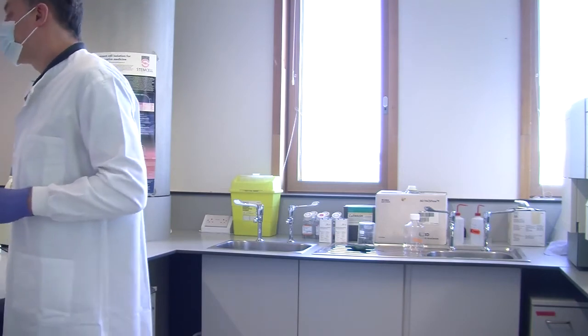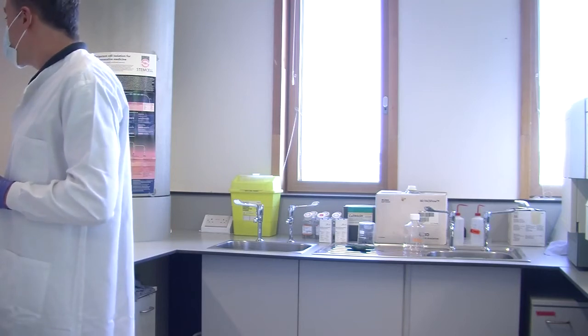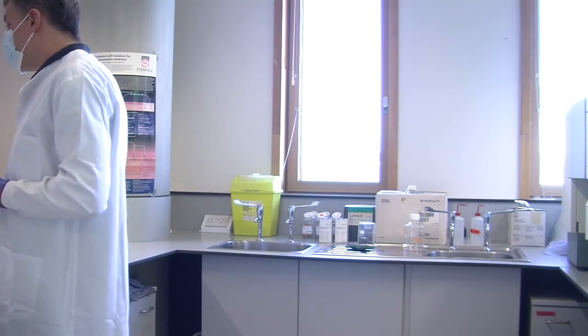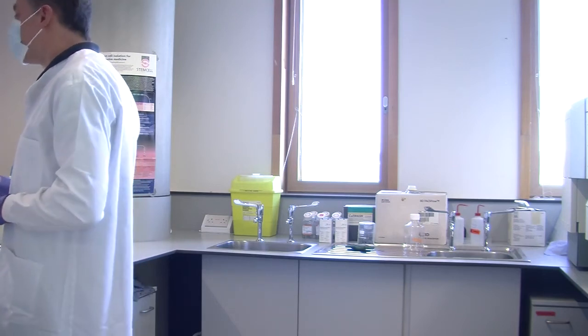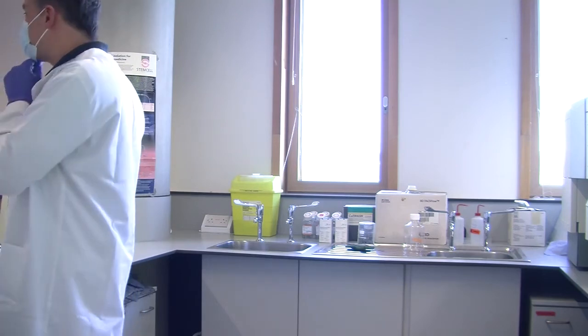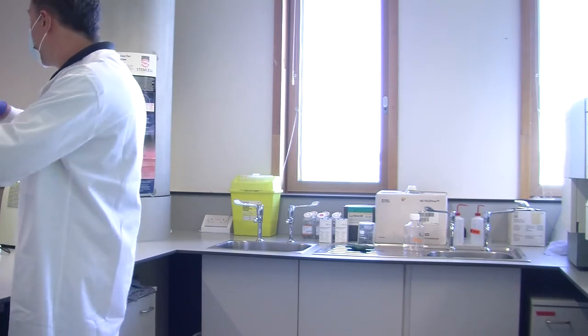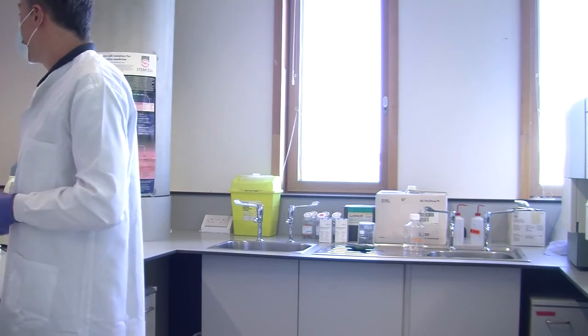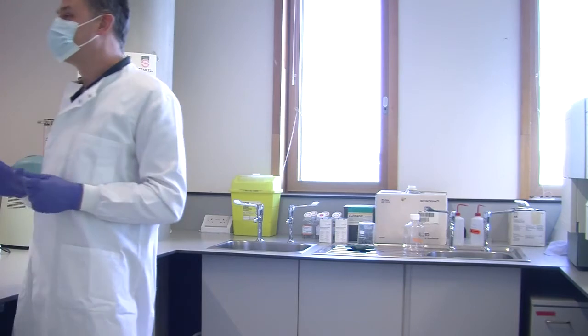So, have you labelled your tubes with your initials and what they are? Always label your tubes. I've been in far too many research labs where you open a fridge and you see a whole rack of tubes labelled 1, 2, 3, 4, 5 up to 65 or whatever. No name, no date, no ID, nothing.